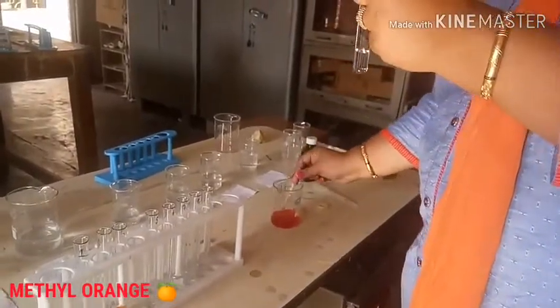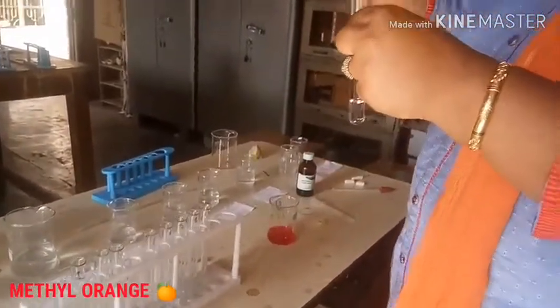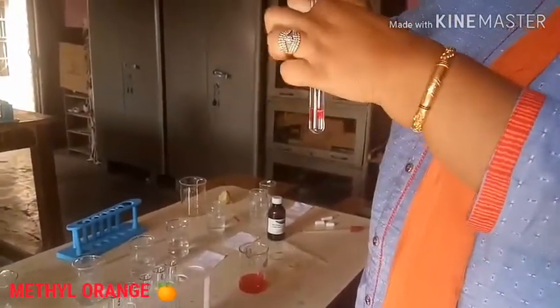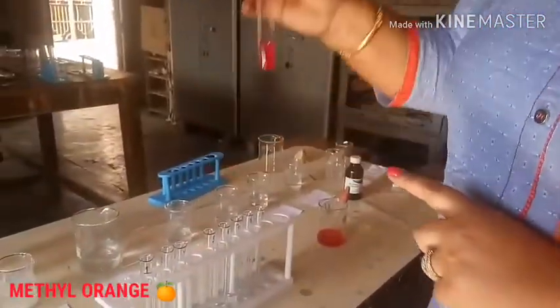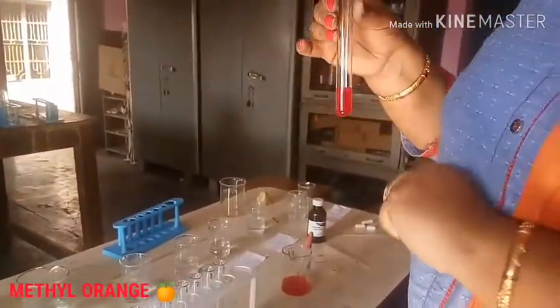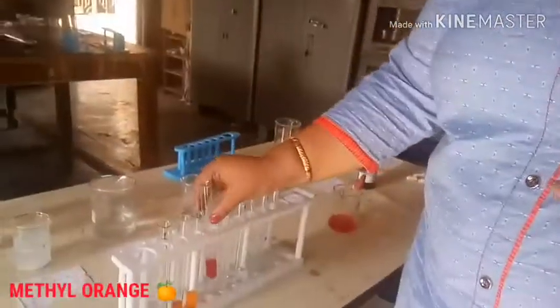Our fourth sample is hydrochloric acid. I am putting two to three drops of Methyl Orange. It is of deep red color. Acid reacts with Methyl Orange to give red color.